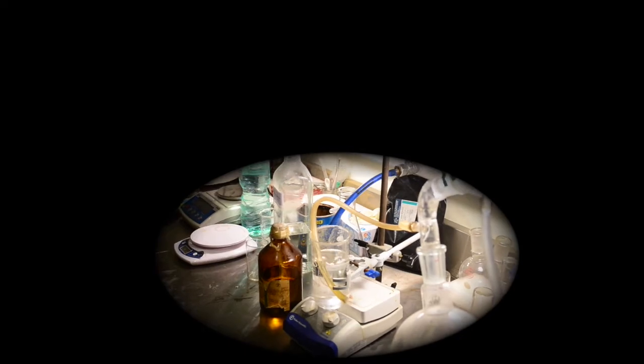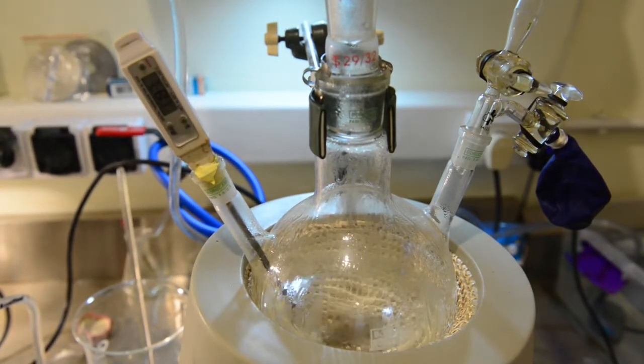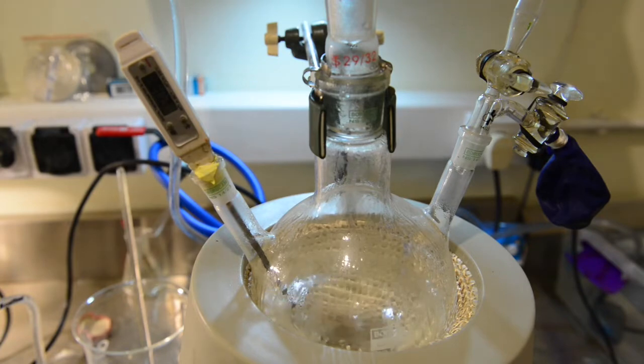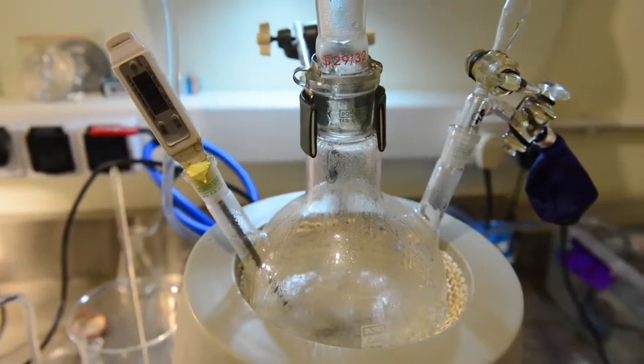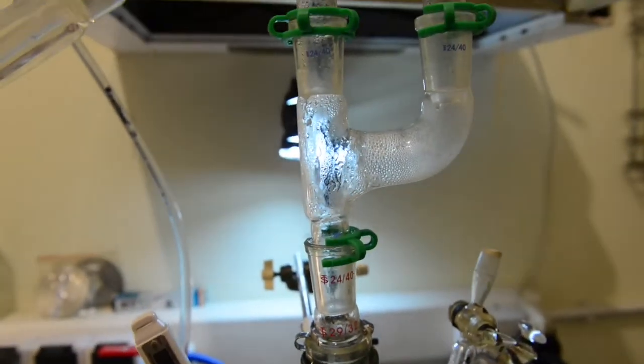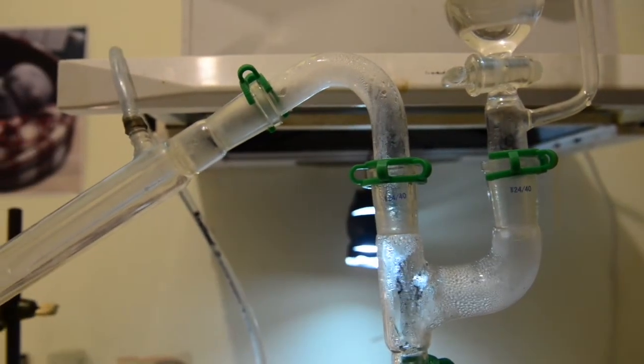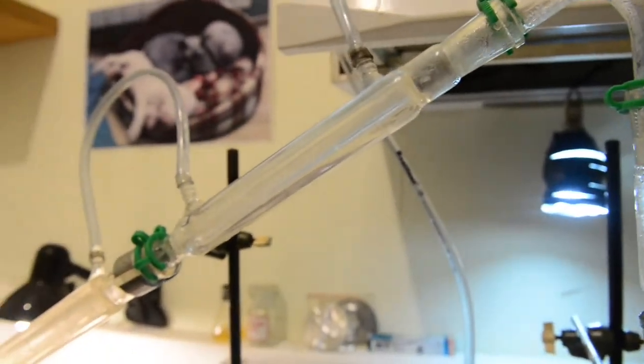The whole process is very time consuming but I will try to demonstrate the most important parts of it. As the temperature rises, you can see the condensation on a flask wall. There is a small evolution of carbon dioxide as well. Our goal is to reach 235 degrees Celsius and maintain for 25 minutes.